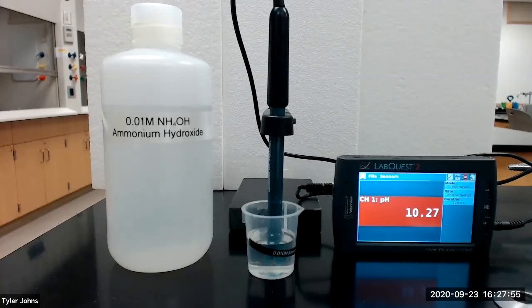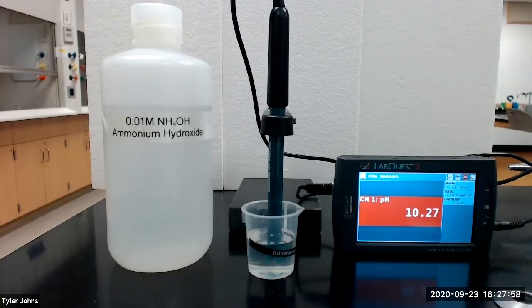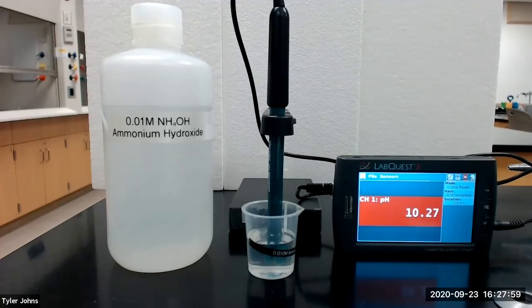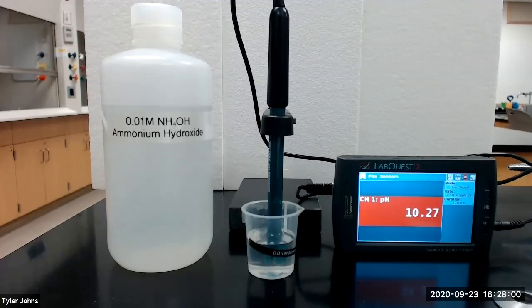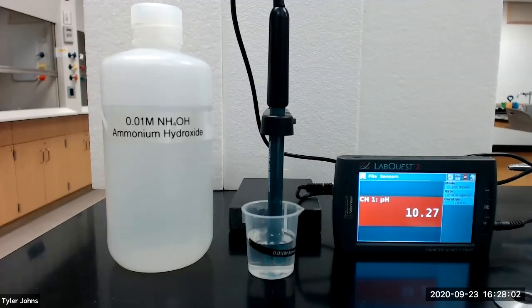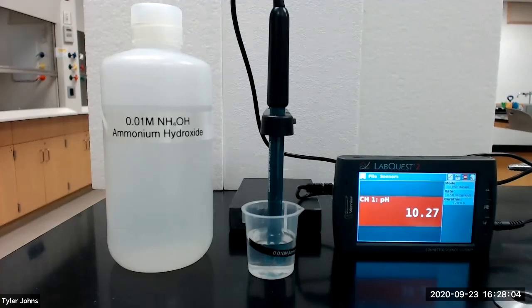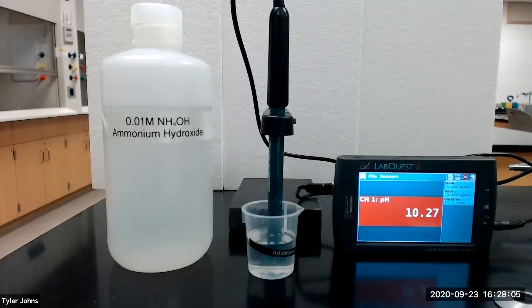You will now need to calculate the value of Ka or Kb and the degree of ionization for each of the solutions we have investigated. This concludes part two of this experiment.